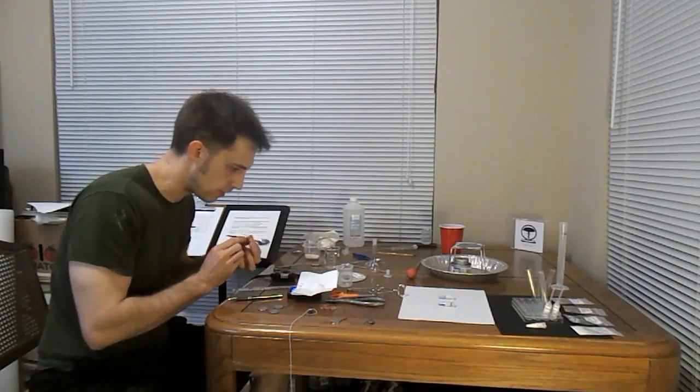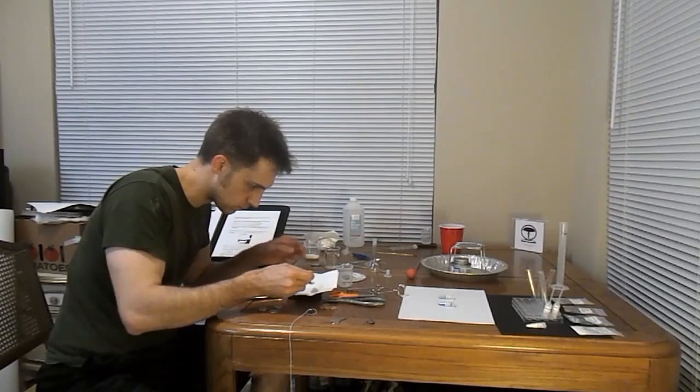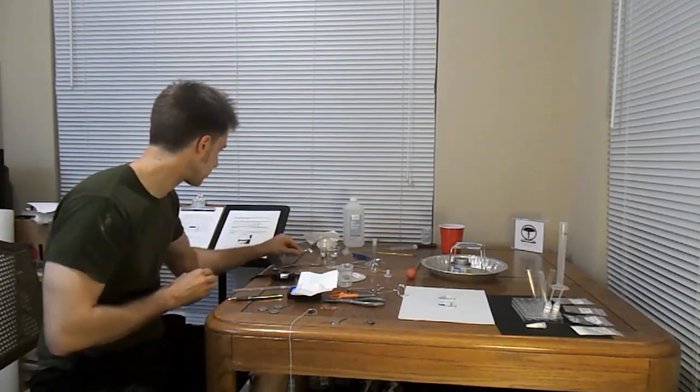A little overboard there. Alright, we're looking at 8.0 grams of sugar, allegedly.